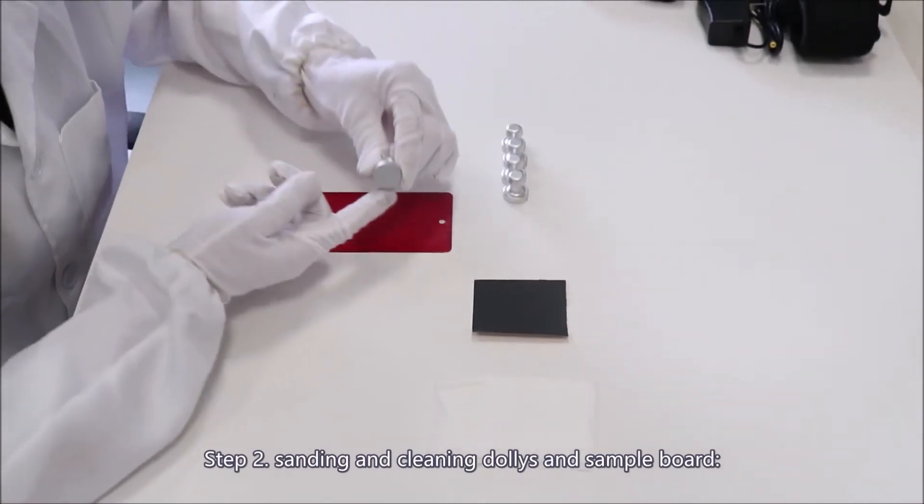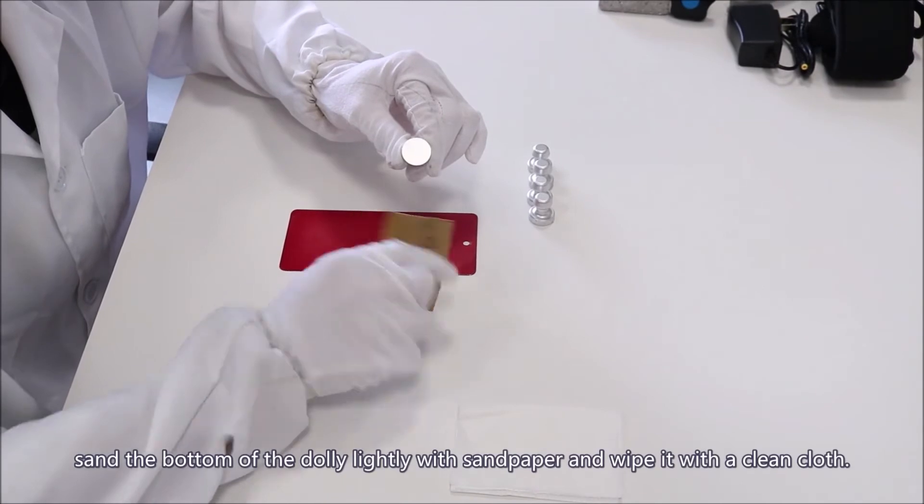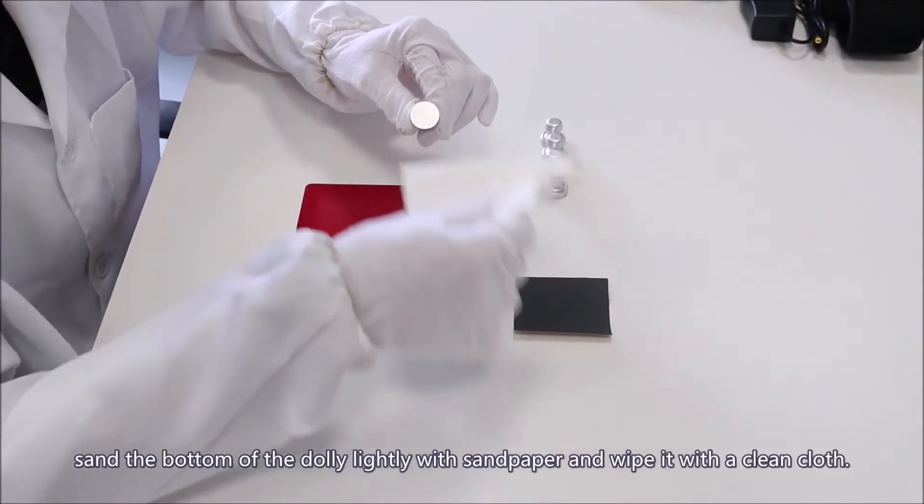Step 2: Sanding and cleaning dollies and sample board. Sand the bottom of the dolly lightly with sandpaper and wipe it with a clean cloth.